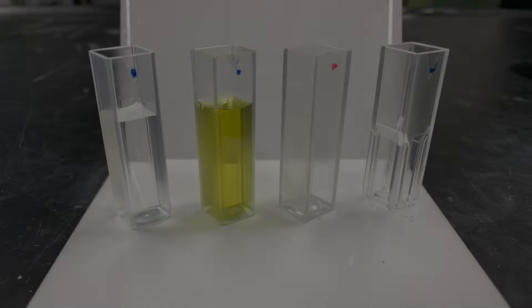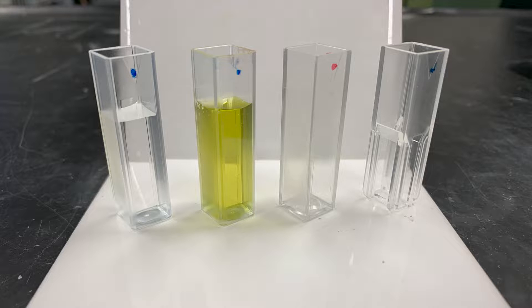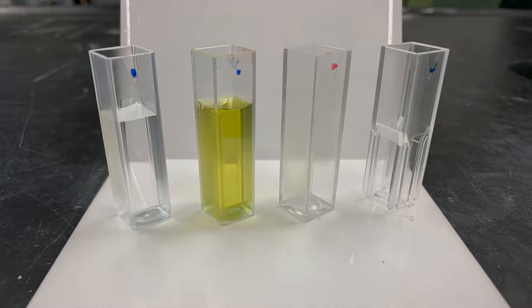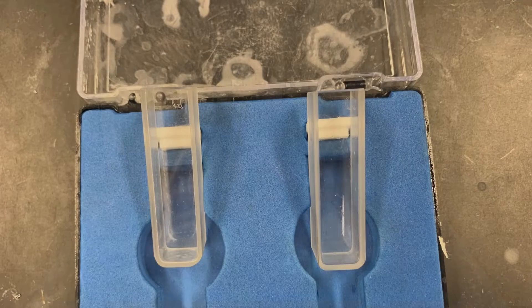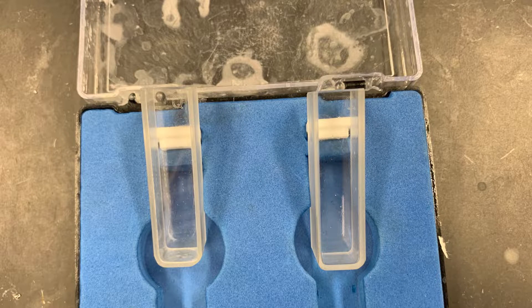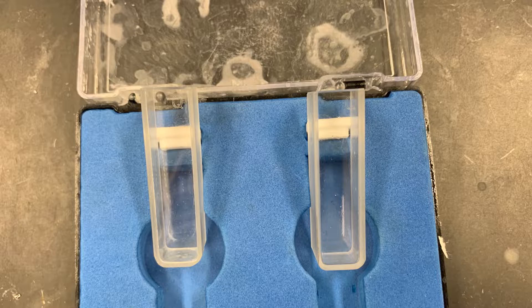Hi, today we'll be learning how to use the UV visible spectrophotometer. Before we begin, let us discuss the different types of cuvettes that you could use. These are the standard plastic cuvettes, which will be used for normal lab work. These, however, are quartz cuvettes. They are very expensive and should only be used for highly corrosive substances.